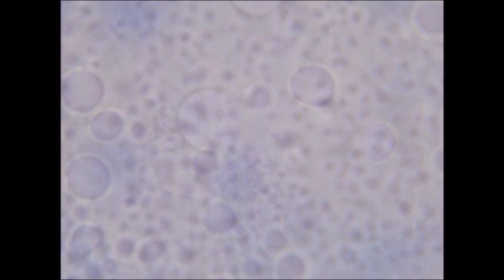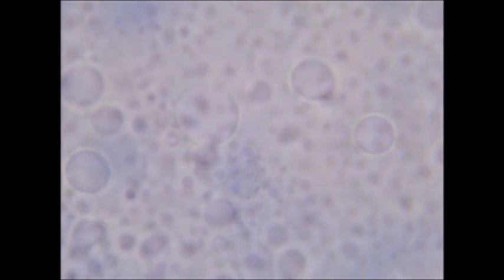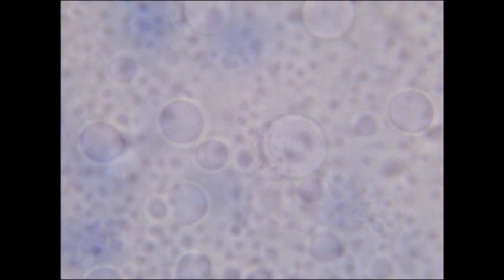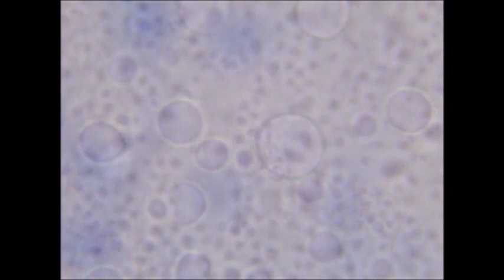So what we're seeing here is one vesicle swallowing the other one — basically becoming assimilated. The one vesicle becomes assimilated after being swallowed up by the other one.